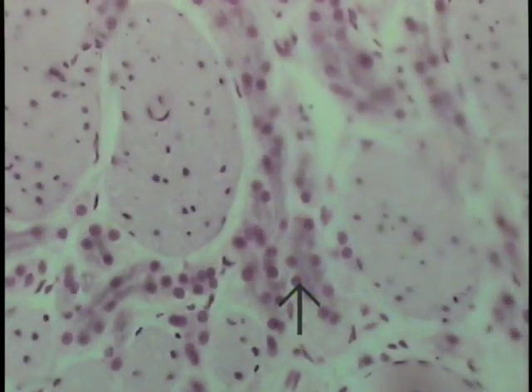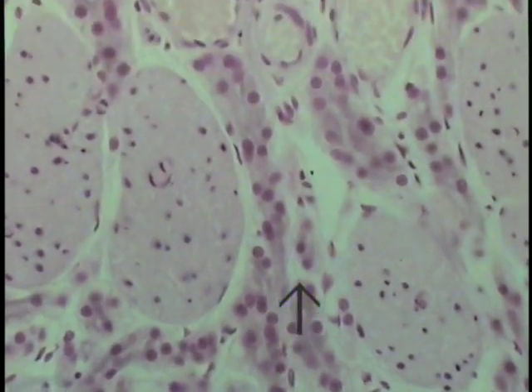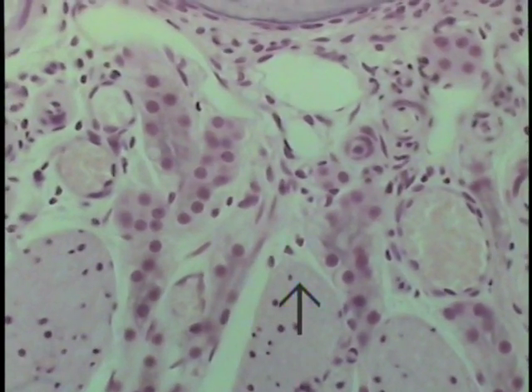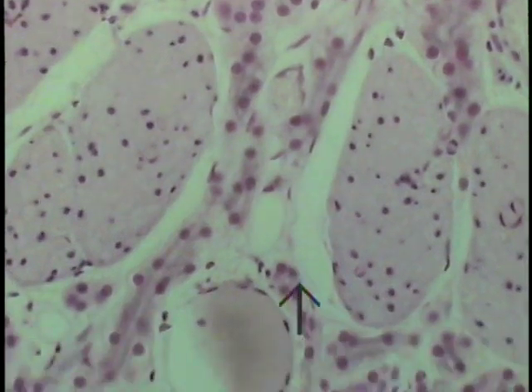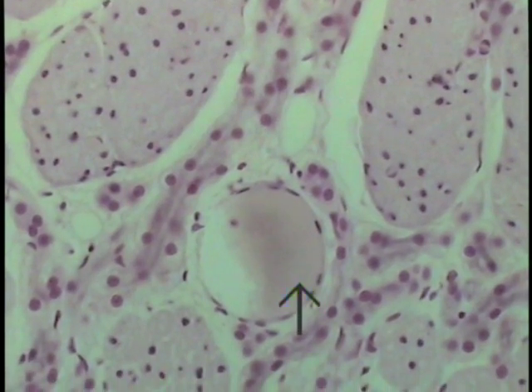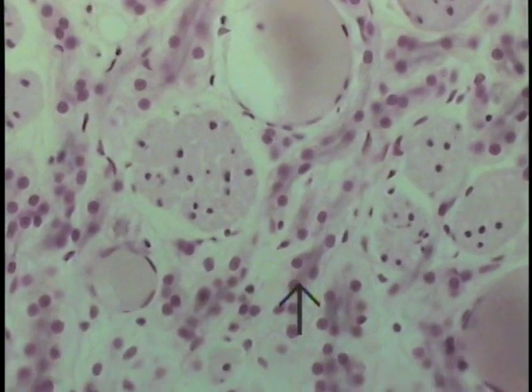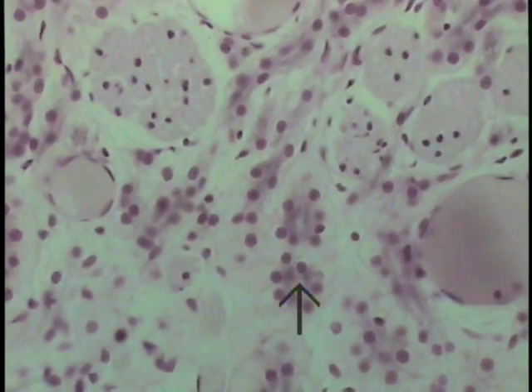A very thin, as one would envision, watery type of secretion to lubricate that surface and dissolve molecules so sensory perception can be achieved through the cilia that are actually lying in this thin film of fluid on the apices of the olfactory epithelial cells.